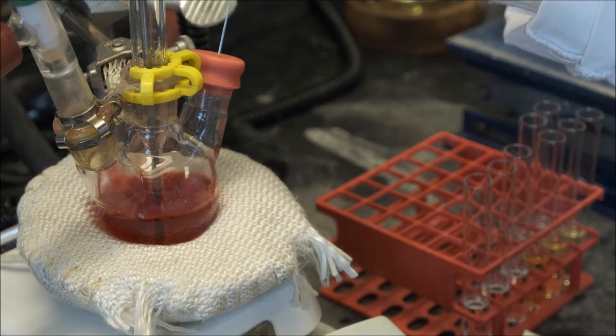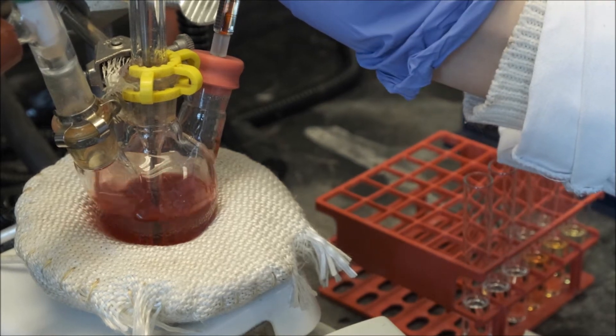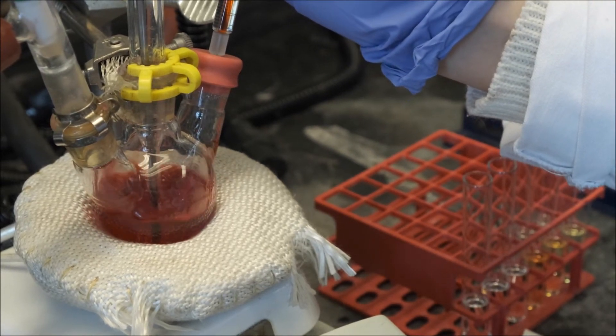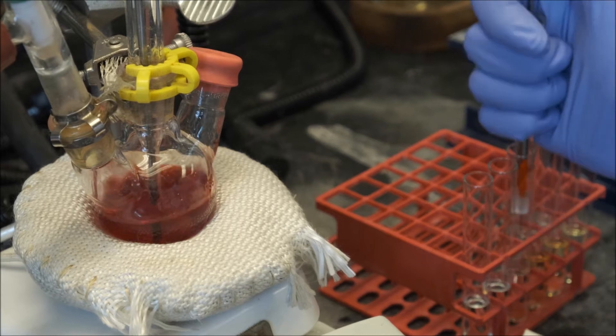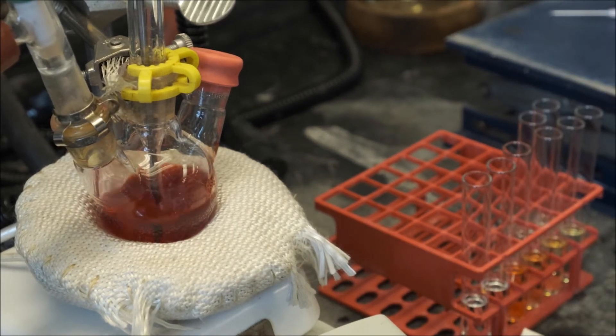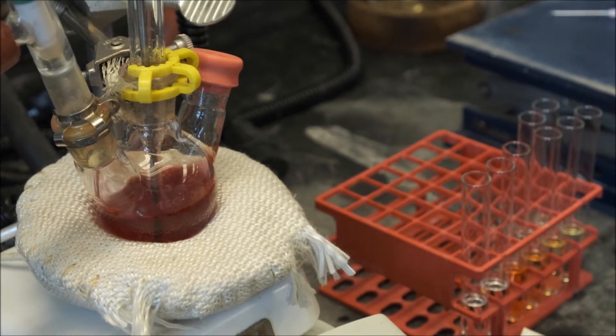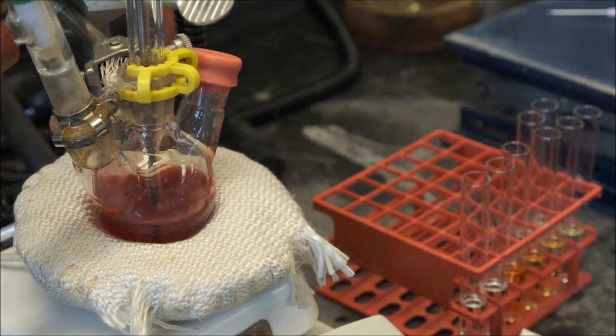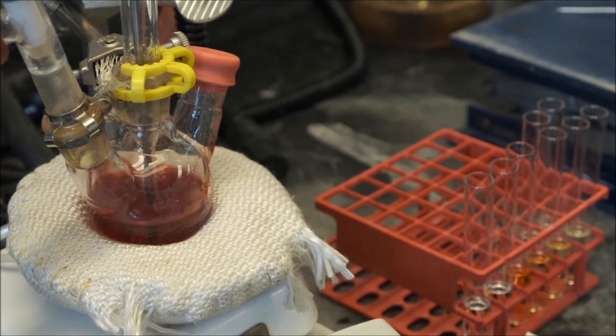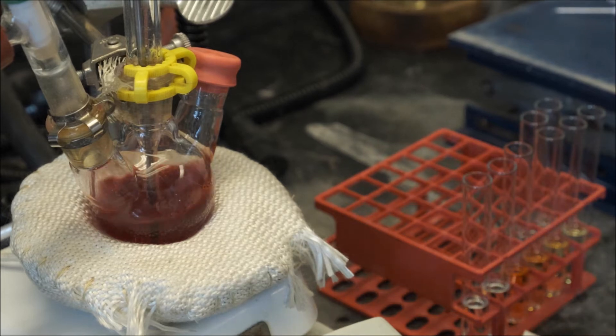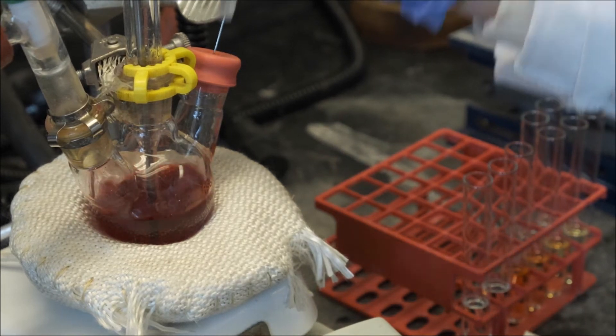As the reaction progresses, the color of the solution changes. This is because quantum dots have optical and electronic properties that are dependent on their size. Here we're taking aliquots at different time points in the synthesis so that we can have cadmium selenide quantum dots of different sizes to compare.